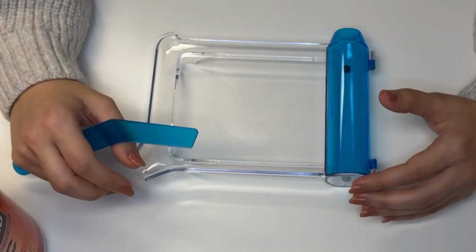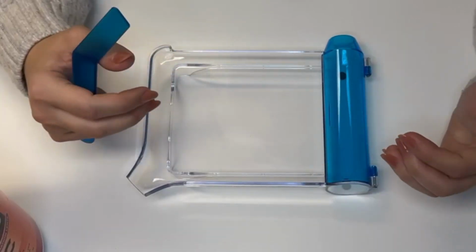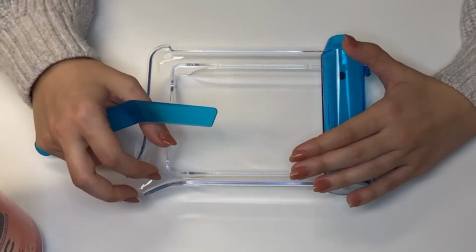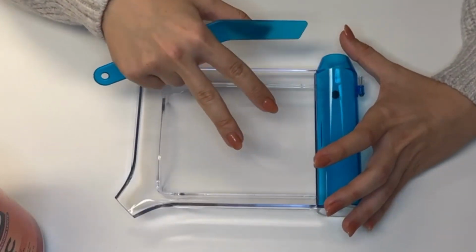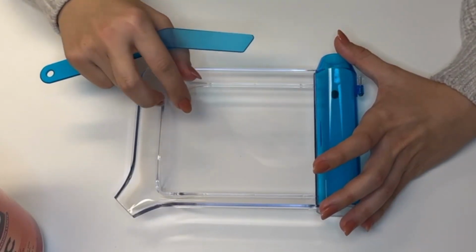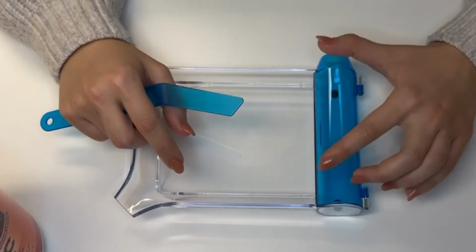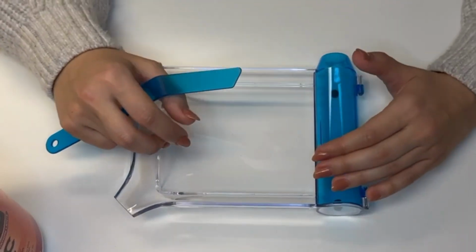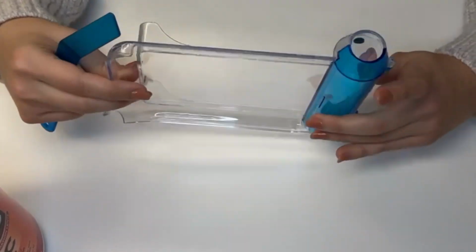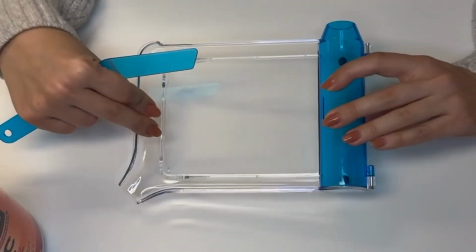Today I'm showing how to use a pharmacy counting tray and the two main ways to count pills, counting by 5 and counting by 3. This is a pharmacy counting tray. The flat surface is where you place the tablets or capsules. The channel here is where you move the pills once they are counted. And the pouring well lets you empty the pills back into the bottle without the spills.